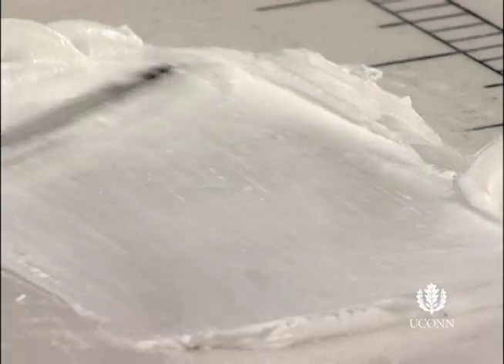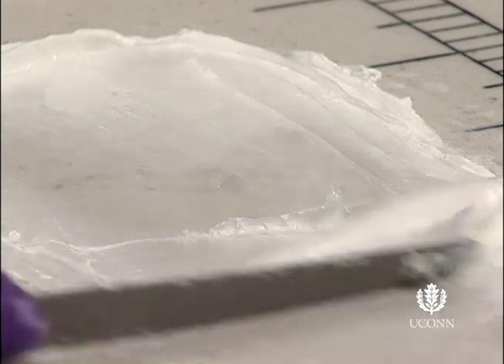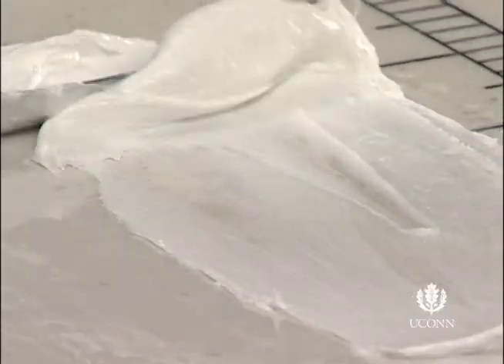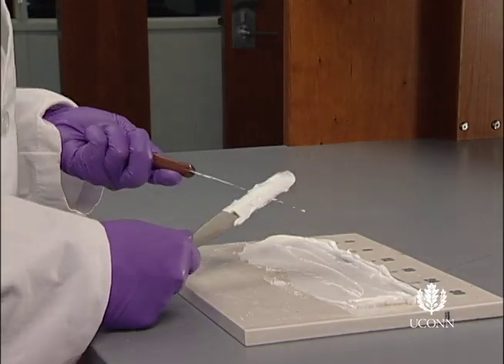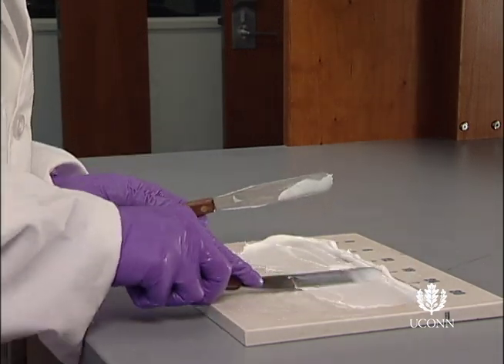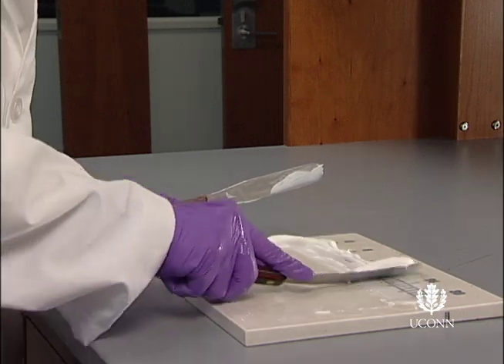It is important to use the entire length of the work surface, as the same force applied by the spatula will shear a thin layer of ointment more than a thicker layer of ointment. In other words, the thinner the layer of ointment, the more effective your spatulation. Using two spatulas may be helpful to ensure no drug or base is left unmixed on either spatula or the outer edges of the pill tile.